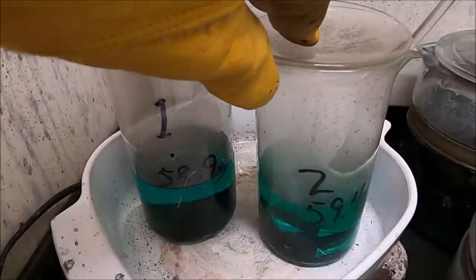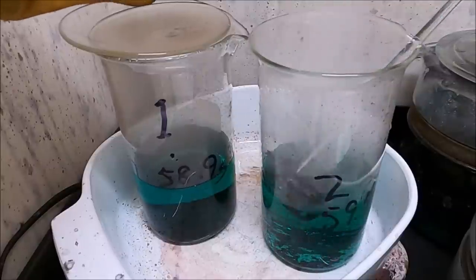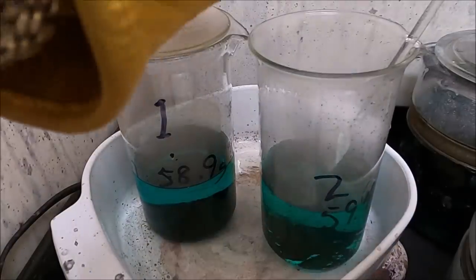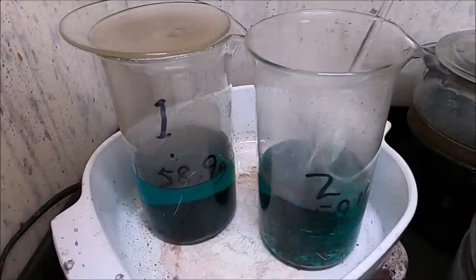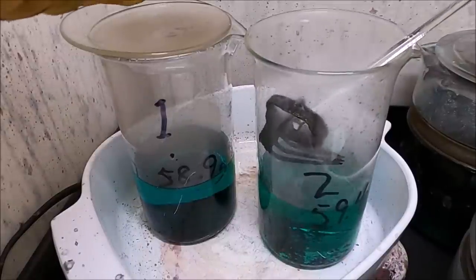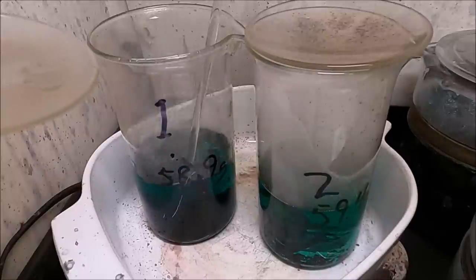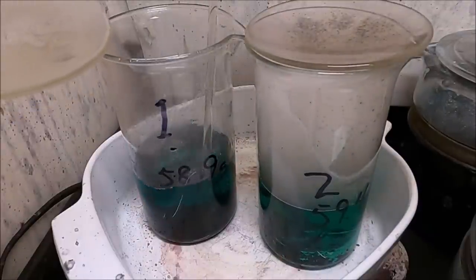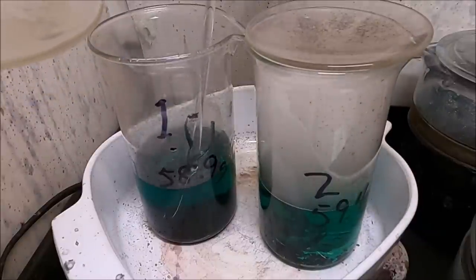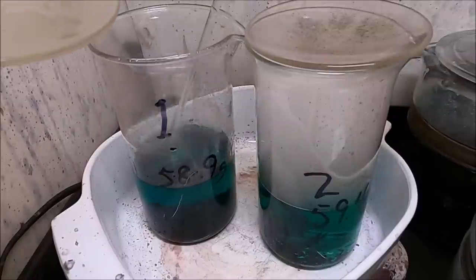This is the following morning. After six hours on the heat yesterday I turned it off and went to bed. I turned it back on around 8:30 and it's now about 10 o'clock — so it's been running another hour and a half. The solid fork is still pretty much in one piece, but the flattened pieces have almost all gone into solution — just a few tiny pieces of silver left. That's the clear benefit of rolling the metal thin before committing it to the acid.